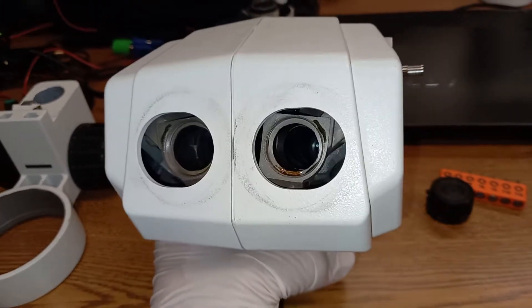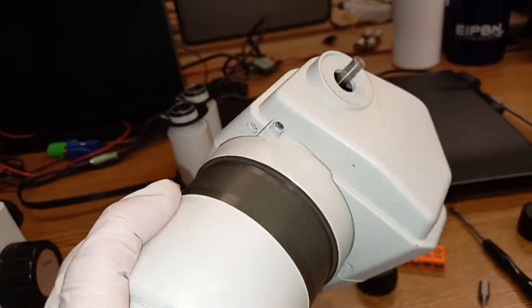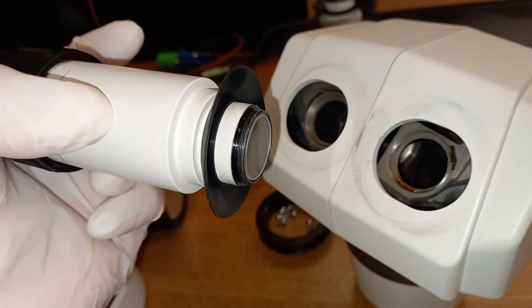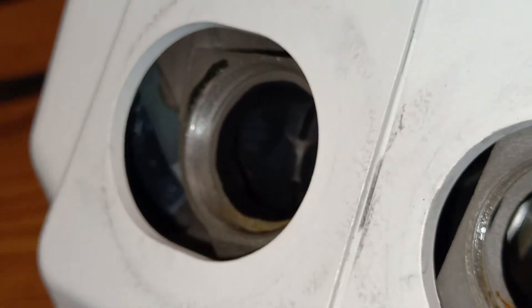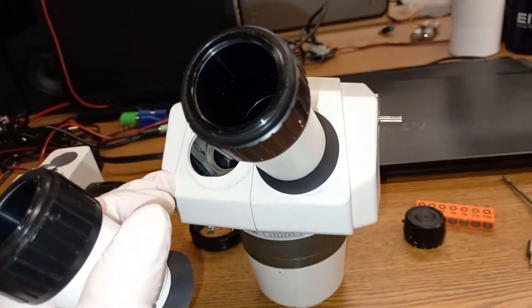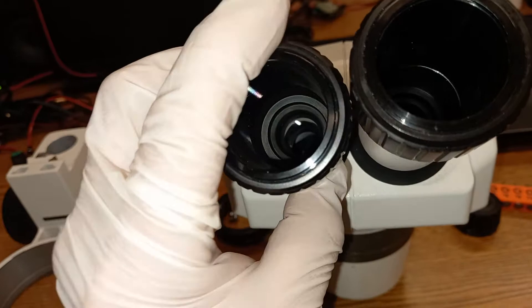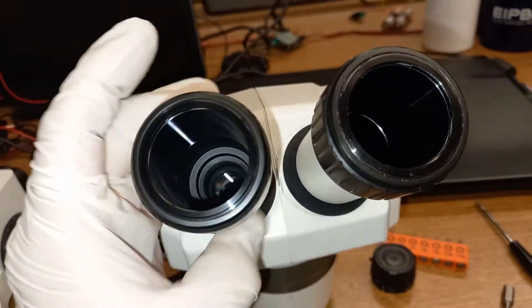It appears like it's looking at me. I have not placed the screws in — it snaps together. I will do the screws in a moment, but right now the next thing I need to do is place this screw mechanism of this lens housing into the screws here. See the threads? Let me attach both sides. I screwed in one side, now I need to screw the other side. All you have to do is place it onto the thread and screw it. I'm tightening this with my hands — hand tight.